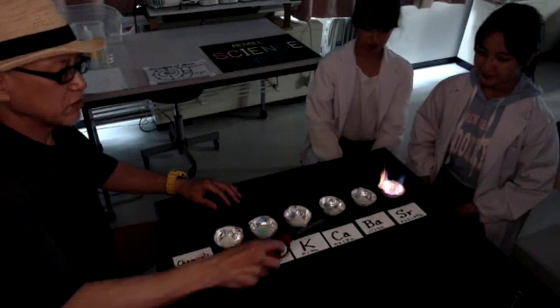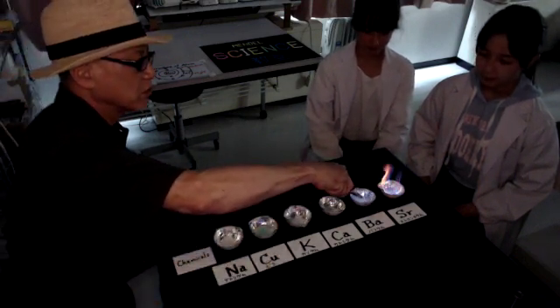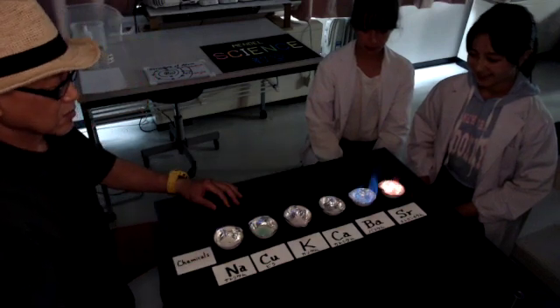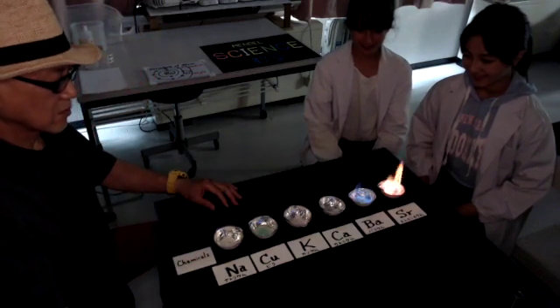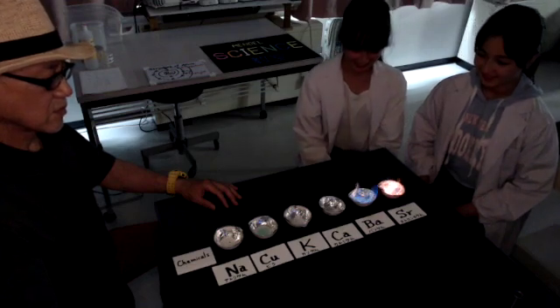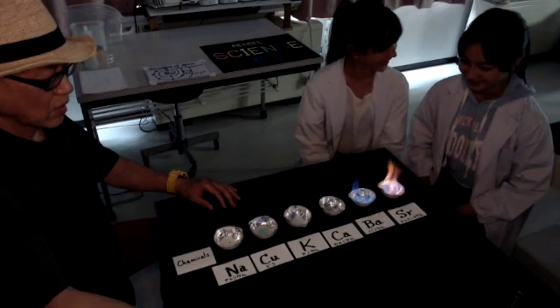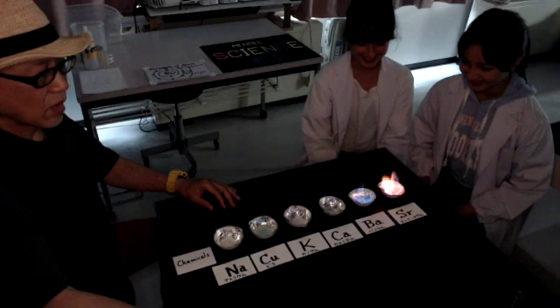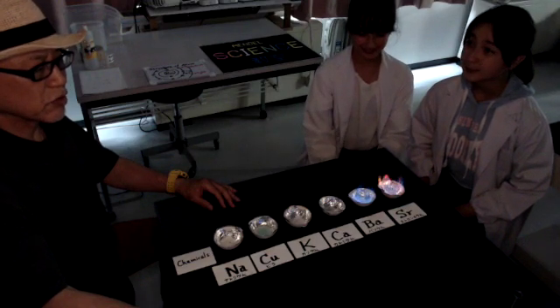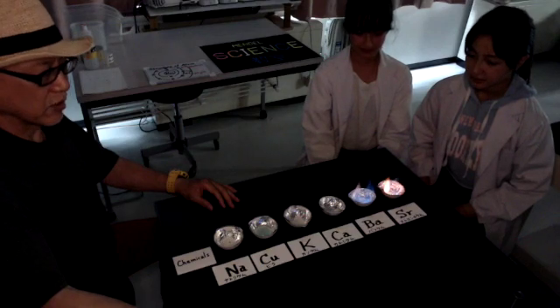Let's move on to the observation of the barium. The flame reaction of barium requires a little bit longer time.